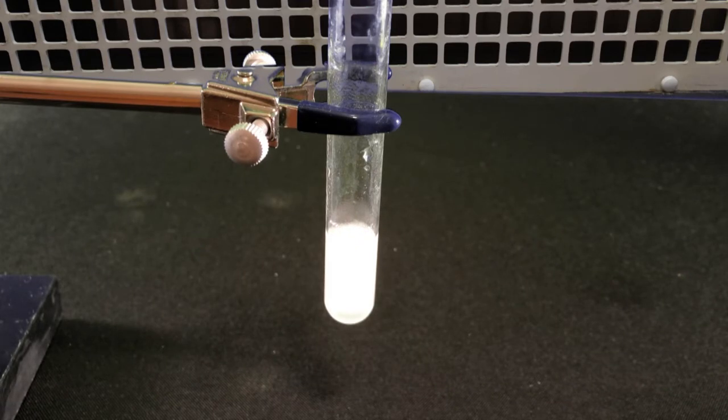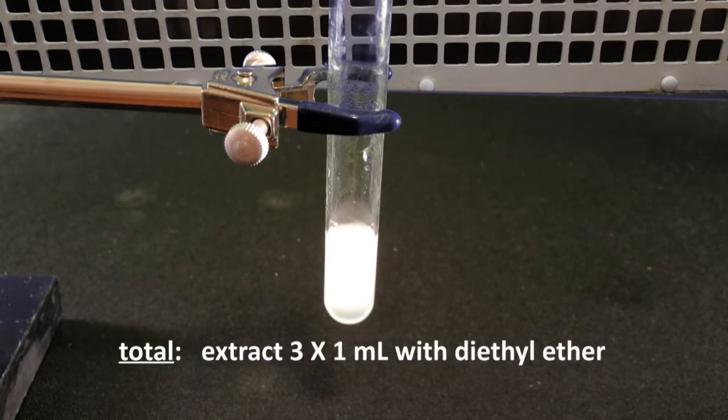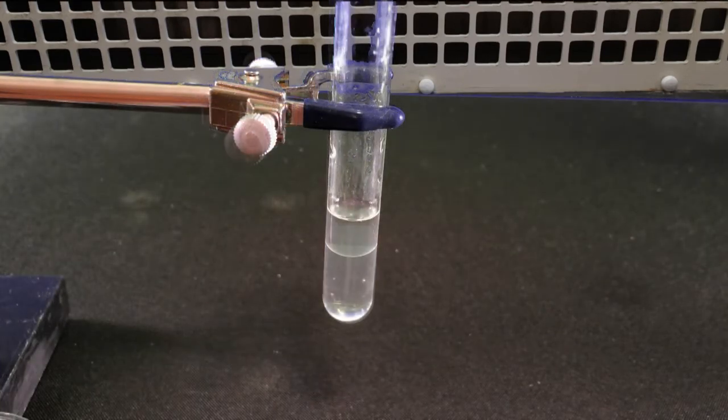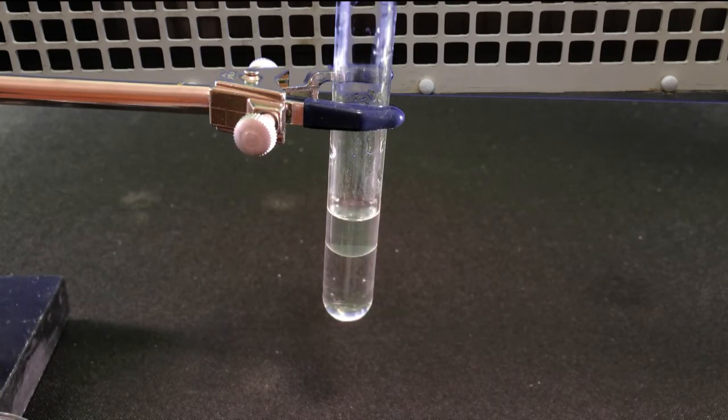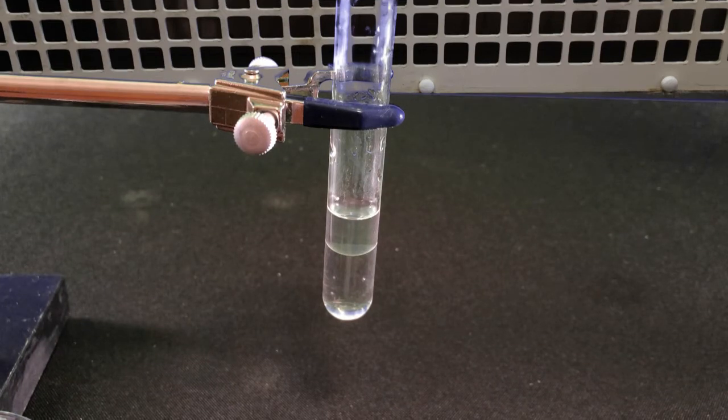You are extracting the reaction mixture with diethyl ether 3 times, each time using 1 ml, or 3 times 1 ml. This is all you need to write in the procedure of your final report for the extraction. The product was extracted with diethyl ether (3 times 1 ml). The extraction technique is a standard operating procedure, so you don't need to include the details of shaking, letting separate, etc.